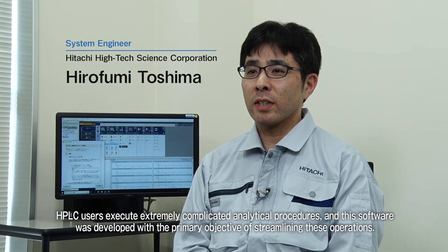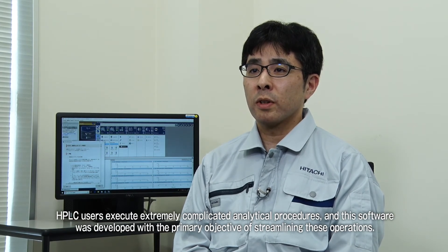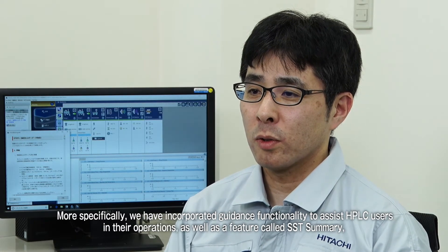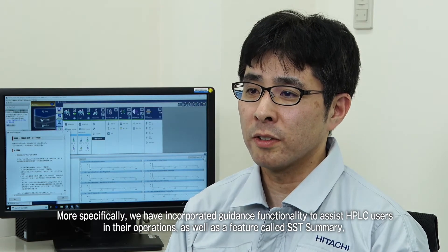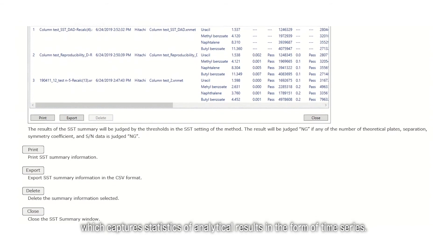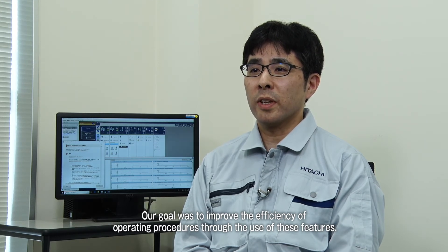HPLC users execute extremely complicated analytical procedures, and this software was developed with the primary objective of streamlining these operations. We have incorporated guidance functionality to assist HPLC users in their operations, as well as a feature called SST Summary, which captures statistics of analytical results in the form of time series. Our goal was to improve the efficiency of operating procedures through the use of these features.